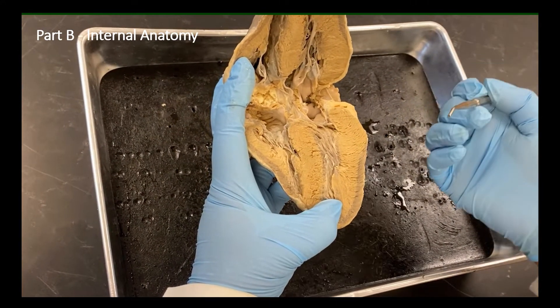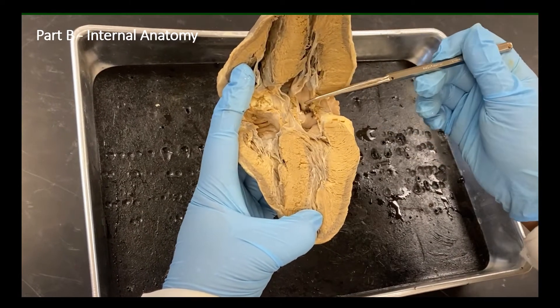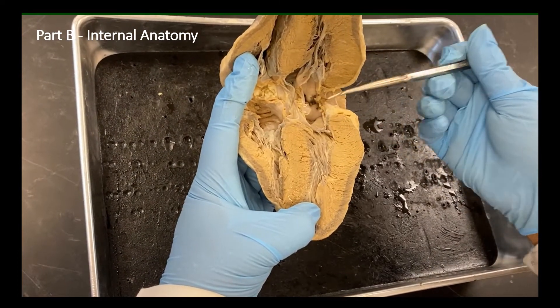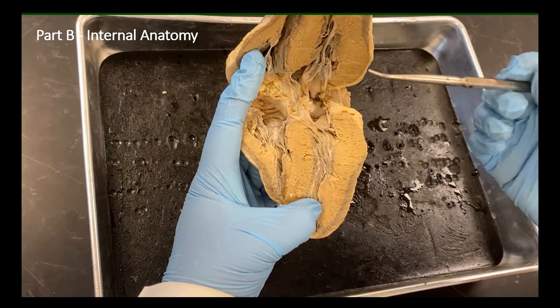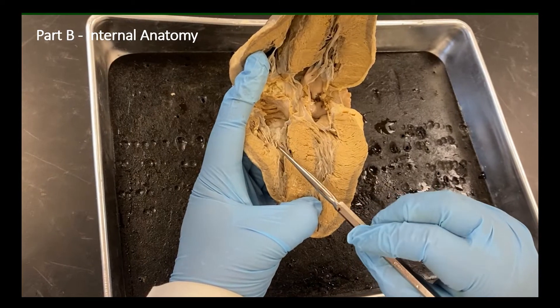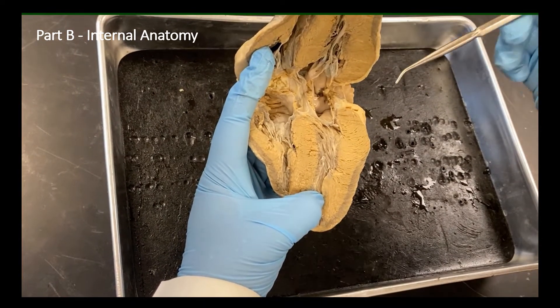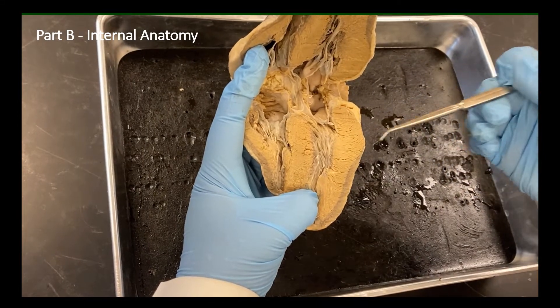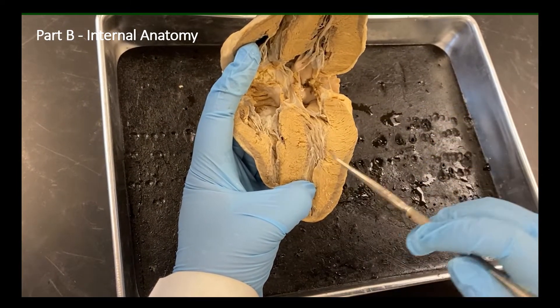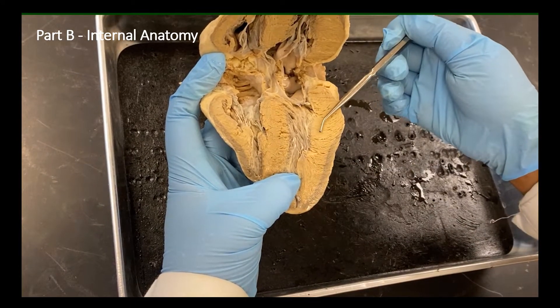Reflect on the functions done by the two ventricles. Blood is pumped from the atria to the ventricles, and from the ventricles the blood will be pumped out of the heart in two distinct regions. From the right ventricle, the blood is pumped to the lungs, which is still in the thoracic cavity, close to the heart. From the left ventricle, the blood needs to be pumped to each and every corner of the body. That anatomy is reflected in the ventricular wall — the muscular wall for the right ventricle is much thinner compared to the left ventricle.